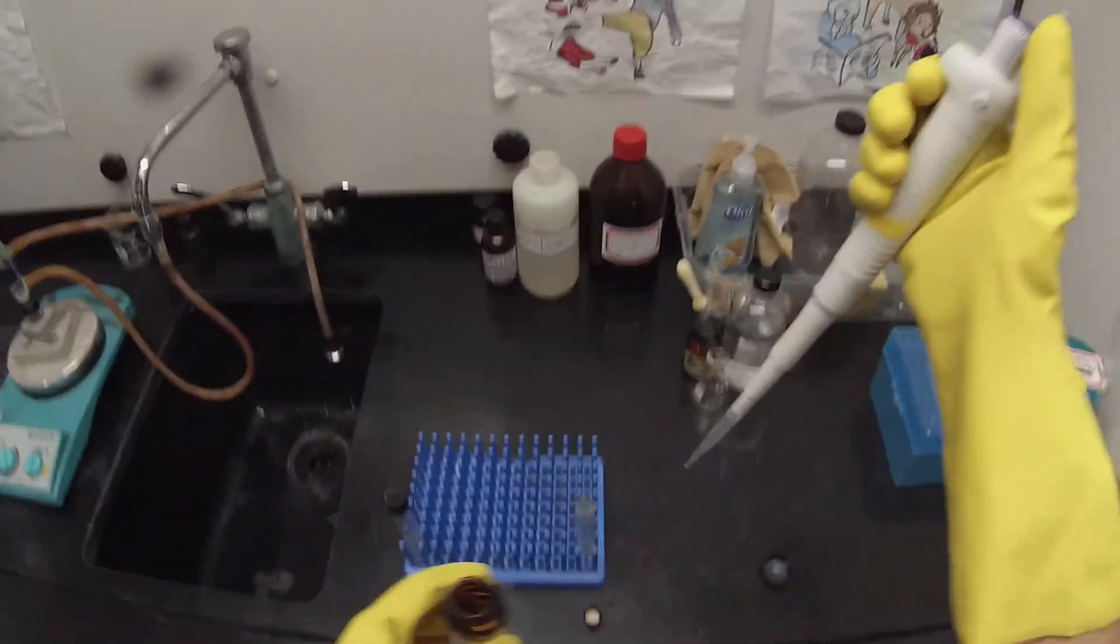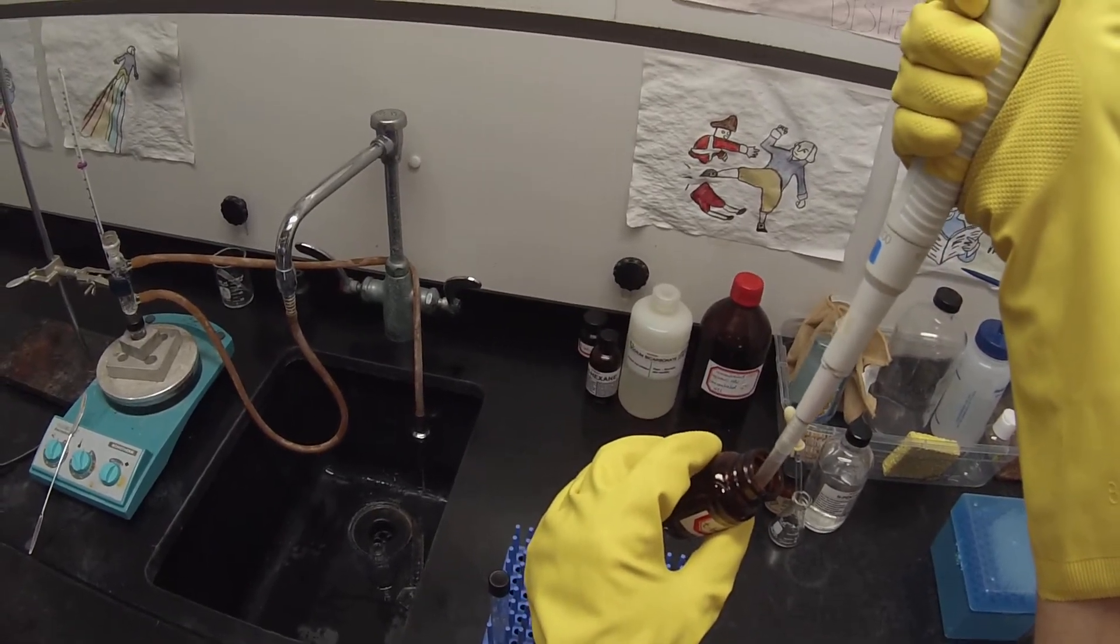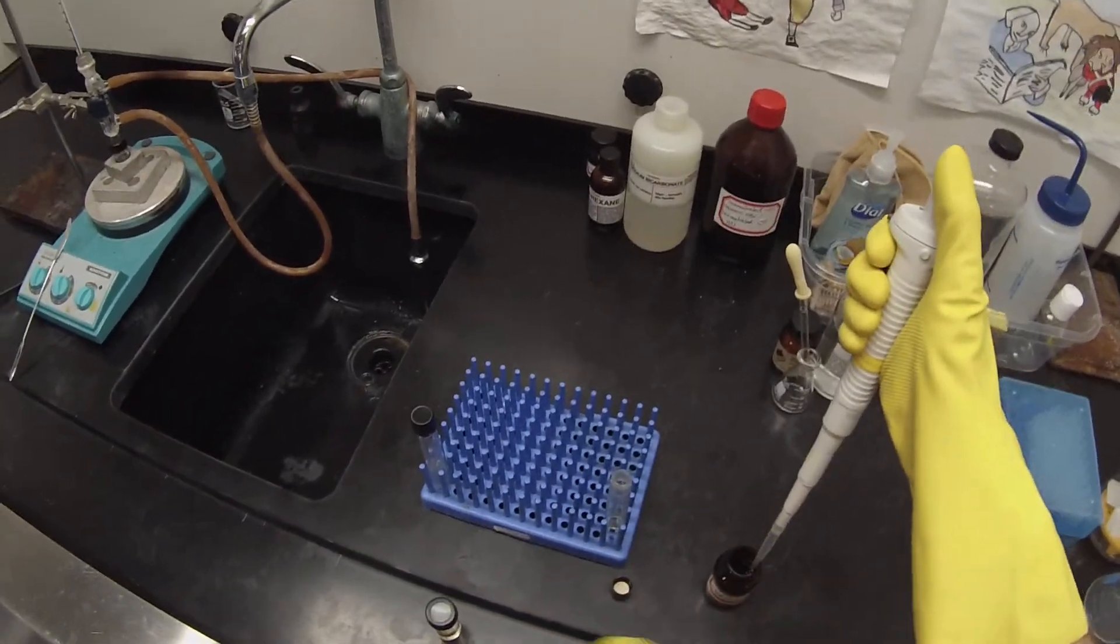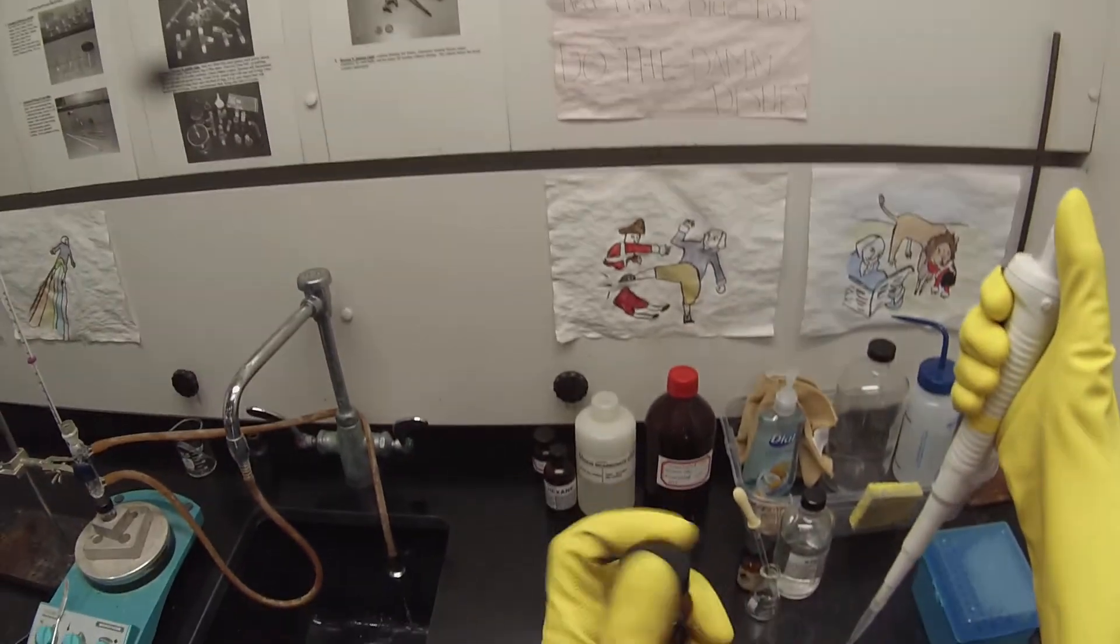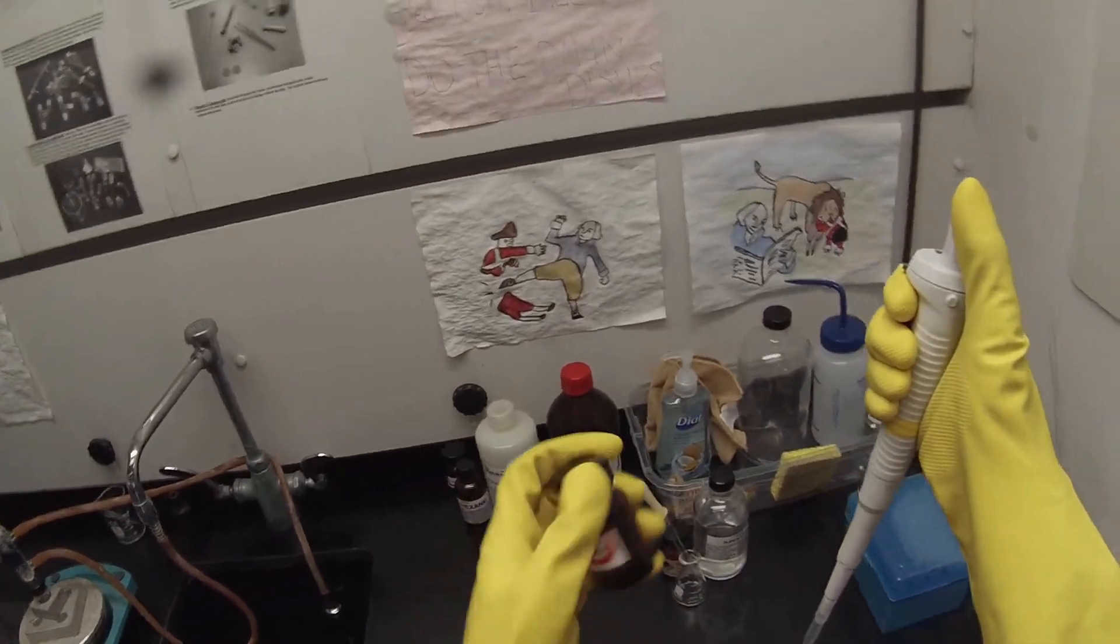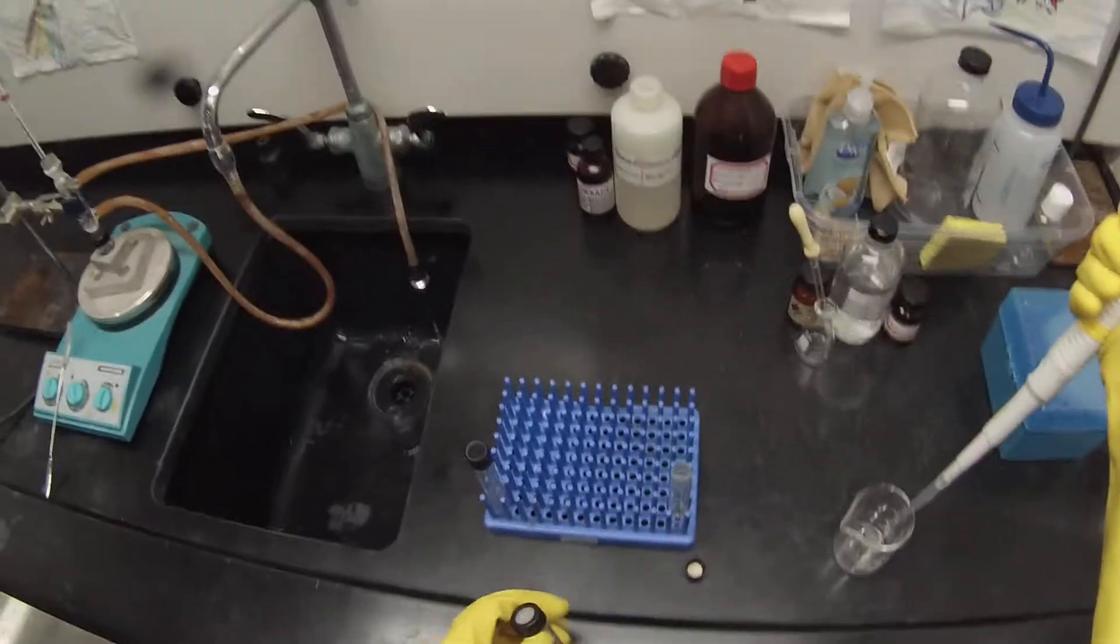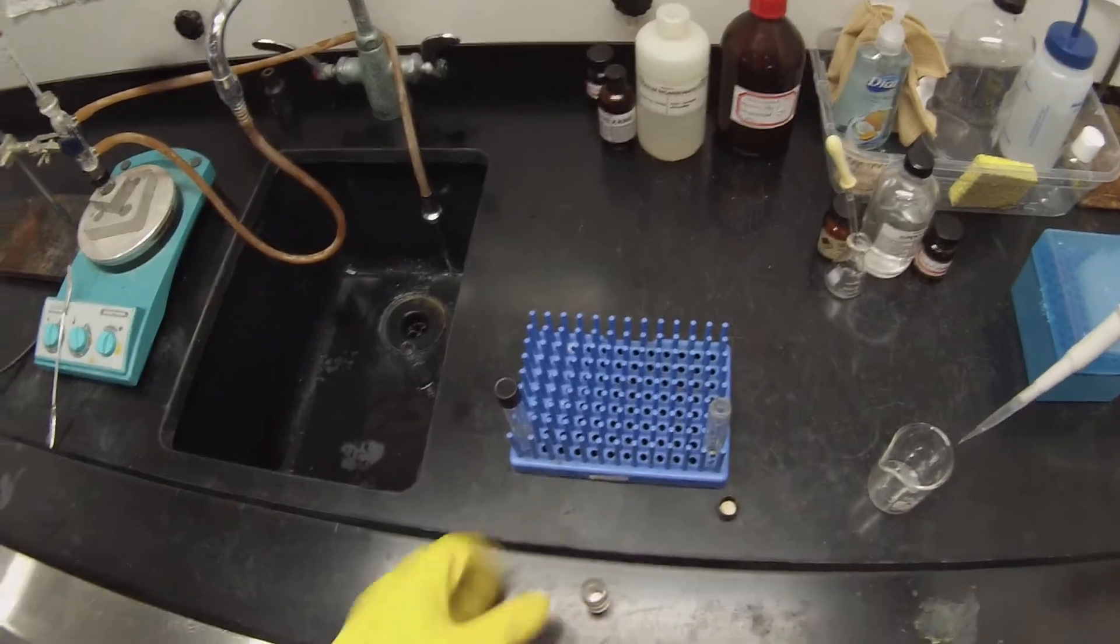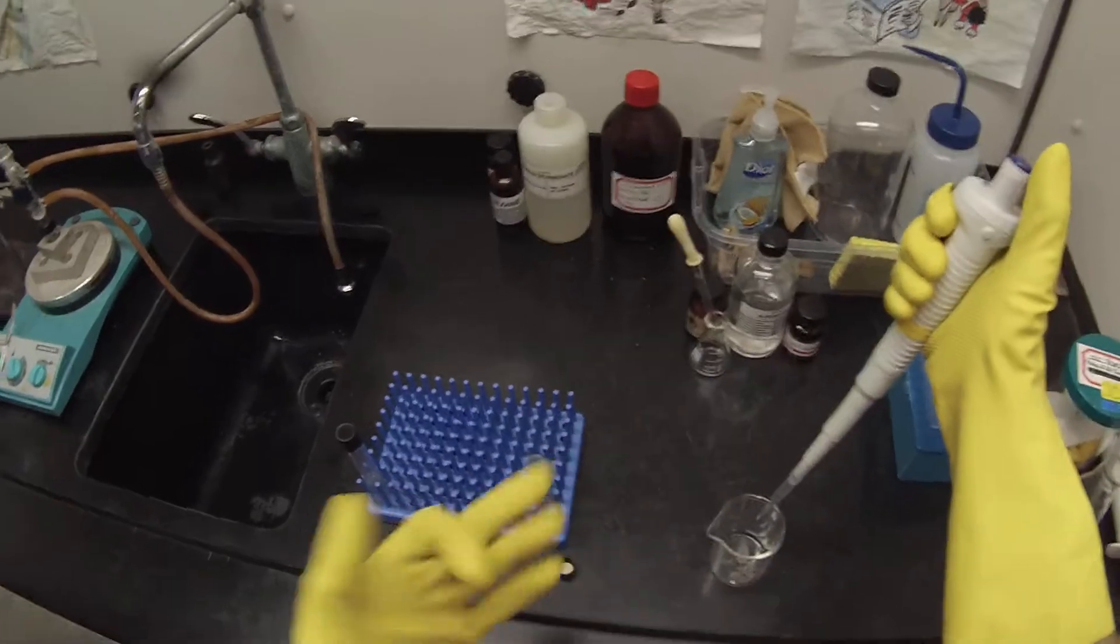Now I'm going to do the same thing for this one, but this one I'm going to do fast. I'm only going to shake that for 15 seconds, and I'm going to let it settle and immediately remove the pentane layer. So I'm done with my t-butanol. I've got my beaker back here that I'm going to put this tip in when I'm done so I can set this guy down. And I'm going to take this cap off so that it's ready when I need to transfer the layer. I've got my pipette ready there.